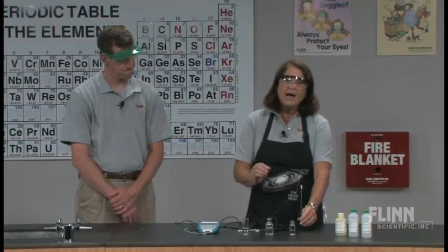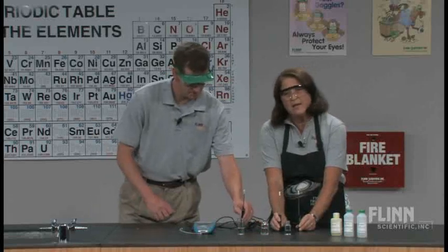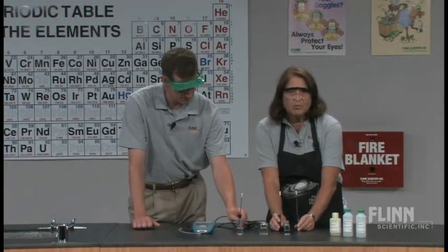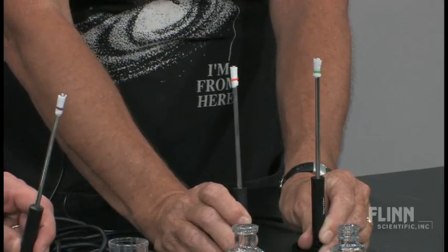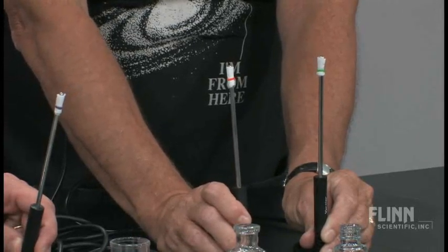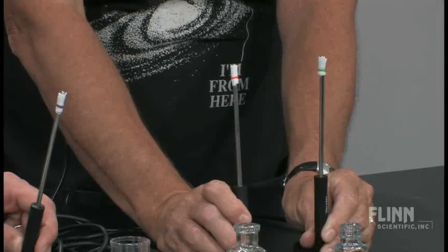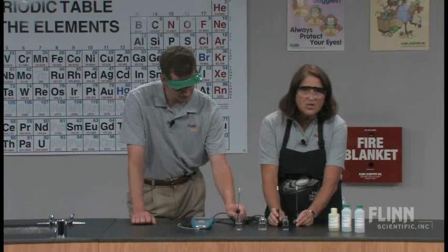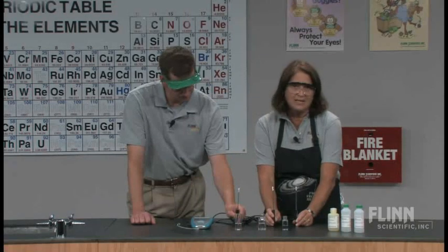I give three probes to my students and they're simply told to wrap a paper towel around the probe. They're not told how to do it, just to get the job done. Their only instructions are to be sure that all three probes are treated exactly the same — the same amount of paper towel, put in the exact same position, the exact same way. You want to make all three identical.